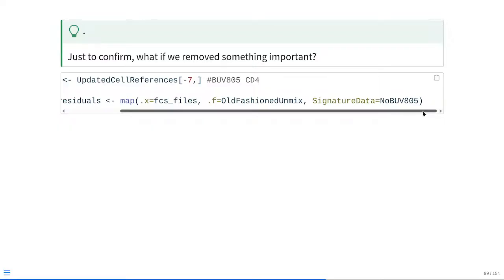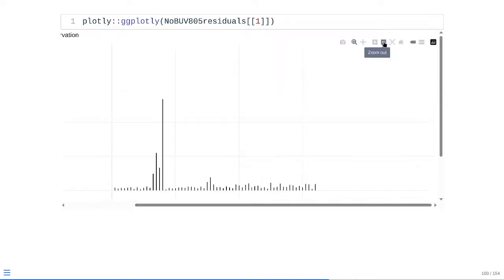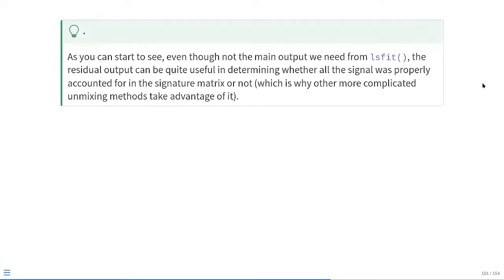If we end up passing that one and carrying out unmixing and then looking at the residual plots, what you're going to see at that point is when we forget to include BUV805, just like we saw with zombie NIR, the corresponding increases where we expect to see them end up appearing. And as you can see, although the residuals are not the main output that we need from LSFit, they can be quite useful in determining whether all the signal was properly accounted for within our signature matrix or not, which is why some of those more complicated unmixing methods end up taking advantage of it.